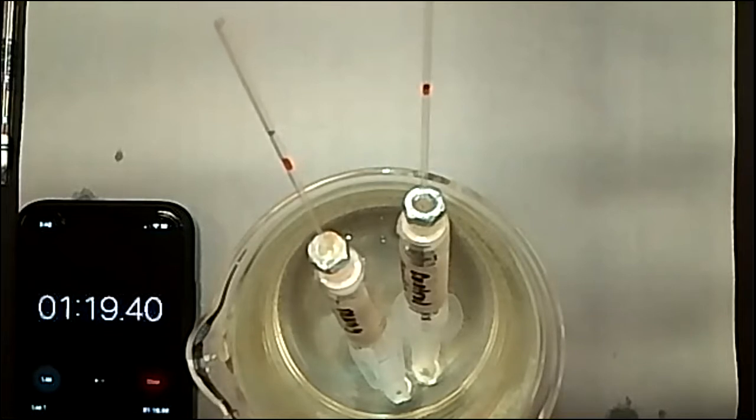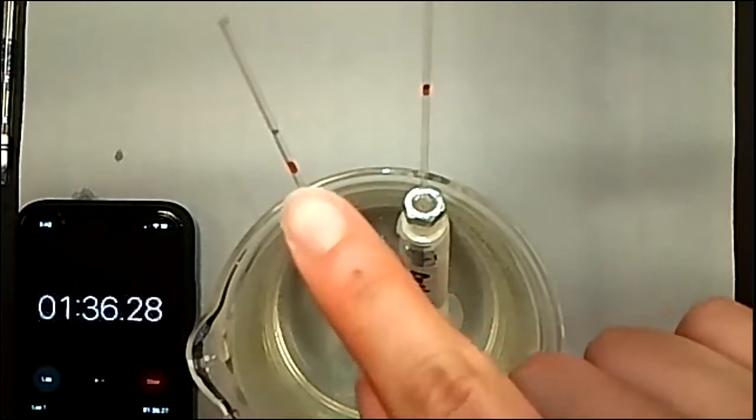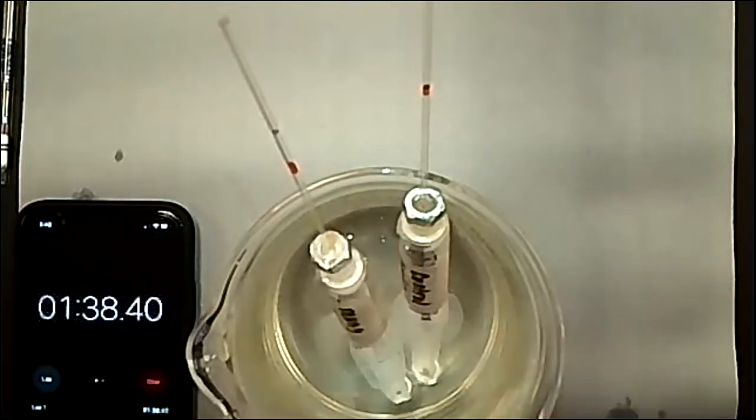And notice, like the procedure said, I'm marking the base of where the plug is to keep it uniform. If I had marked the top of the plug at the beginning, then I would be marking the top of the manometer plug throughout the entire experiment. It doesn't really matter, but they asked to mark the bottom, so I did mark the bottom initially. So I should be marking the bottom of the plugs instead of the top of the plug each time.